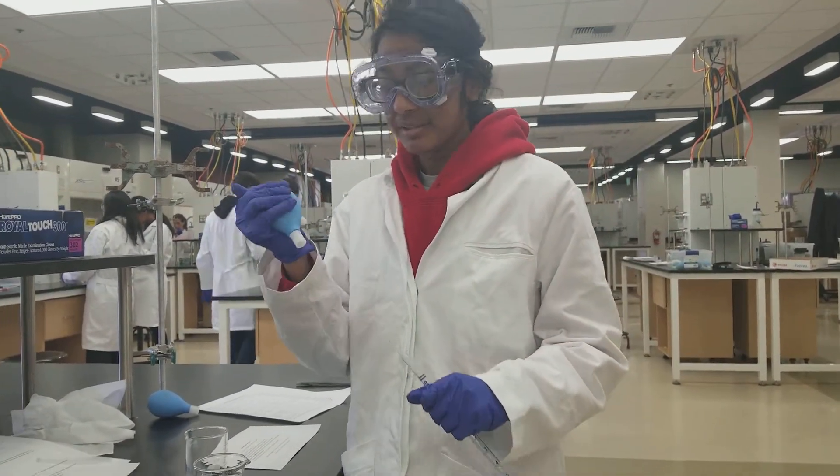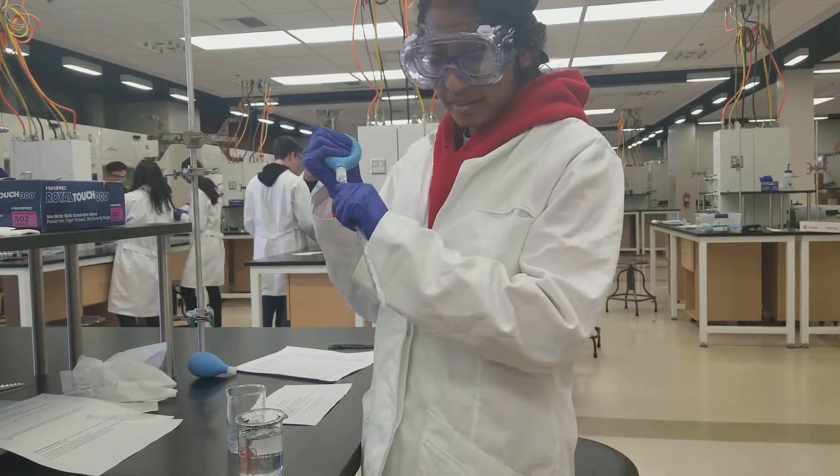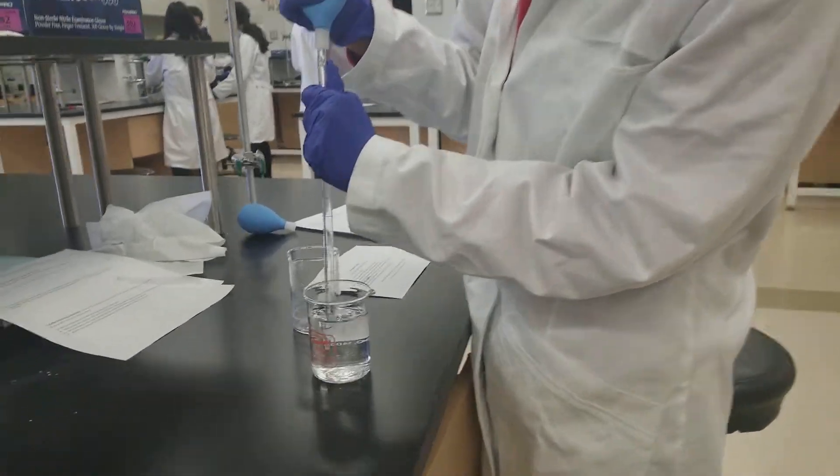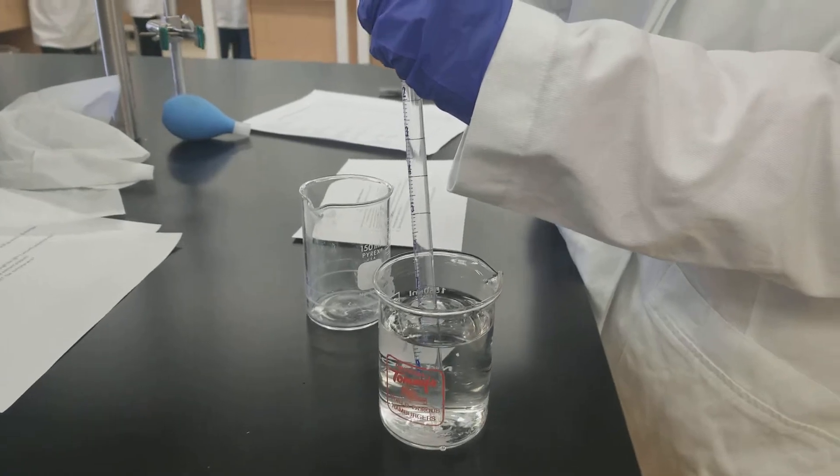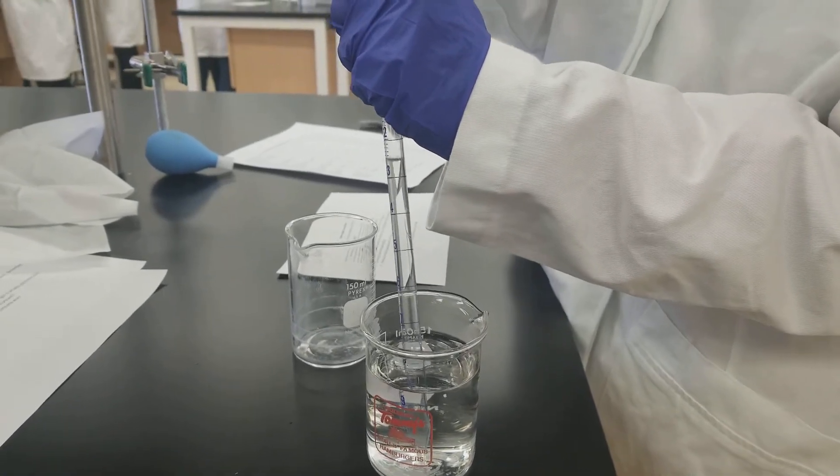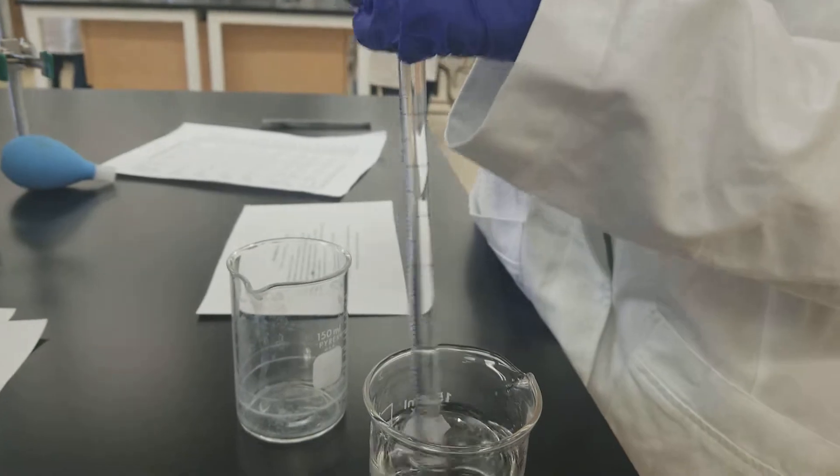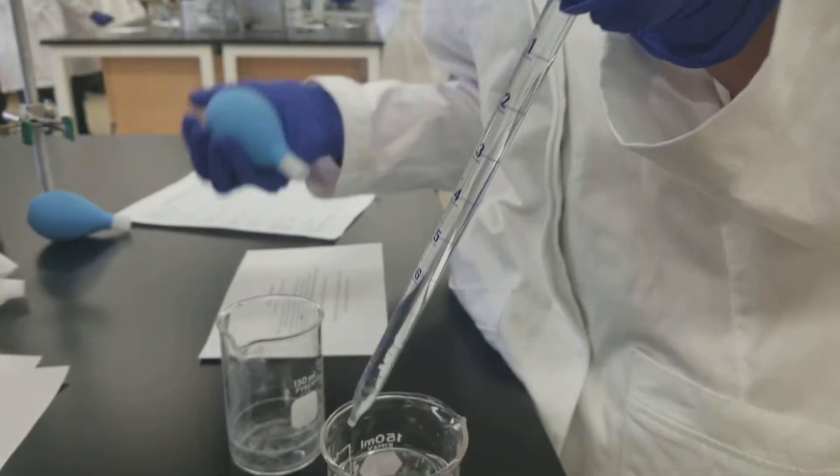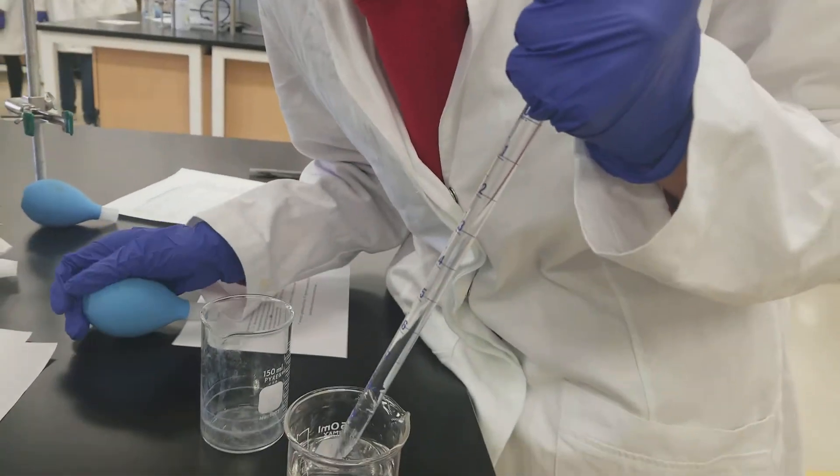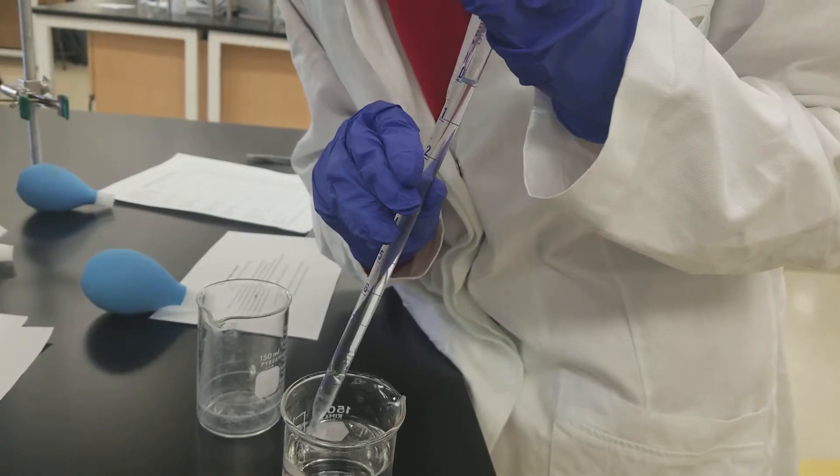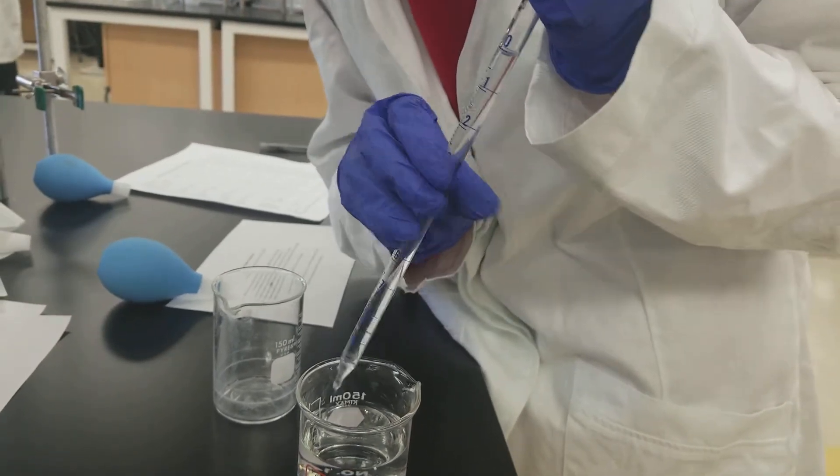Take in more than you need, so I'm trying to get 5 milliliters. So I'm just going to go up to there. And I put my thumb over it so it stops. This is like a lot of milliliters. Transfer it into the empty beaker.